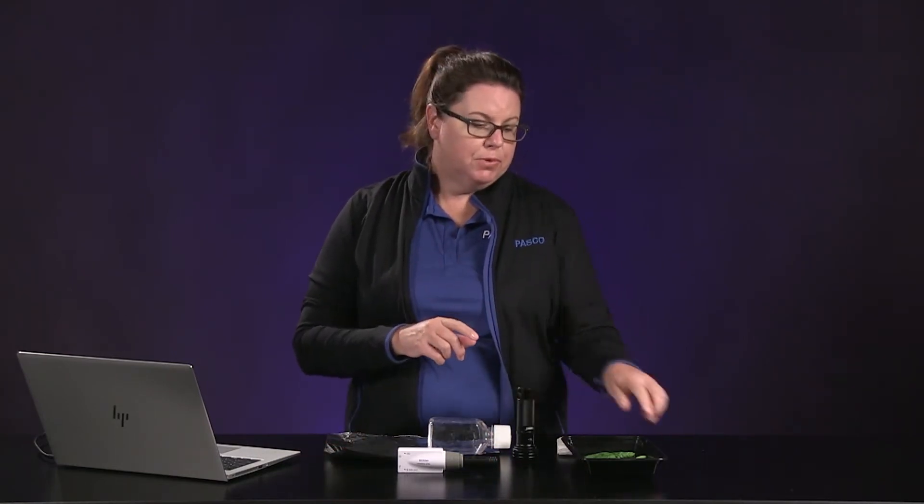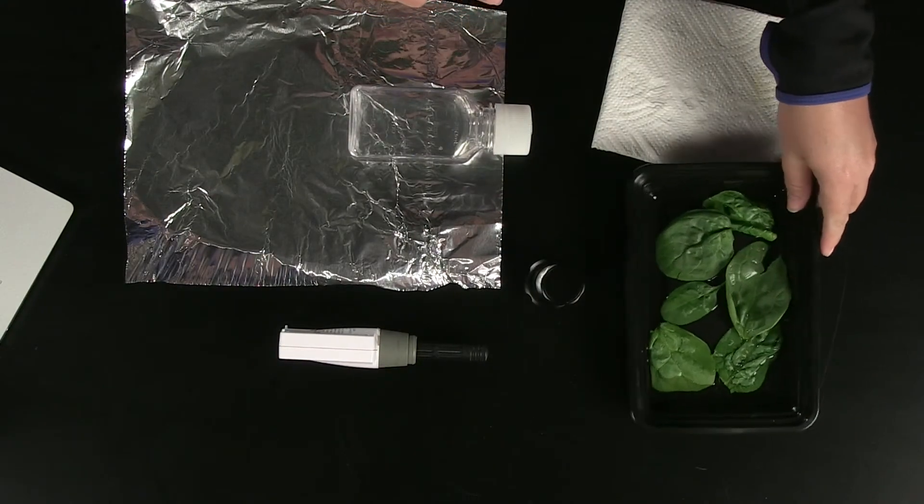For this investigation, we will need a wireless CO2 sensor, a sampling bottle to represent our closed system, a sheet of aluminum foil, and a light source — I'll be using this LED flashlight. You'll also need a couple of spinach leaves. Leaves perform photosynthesis at a higher rate when they are least stressed.